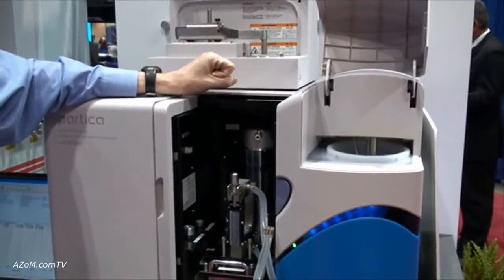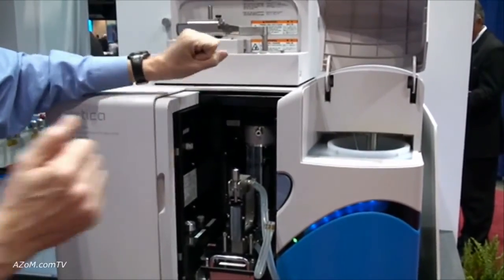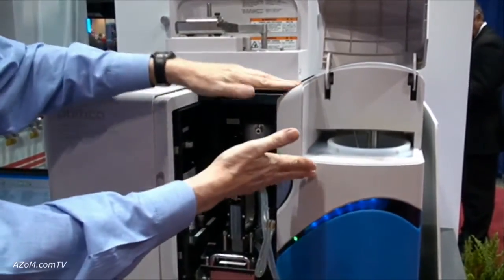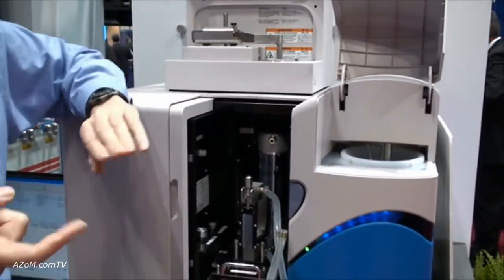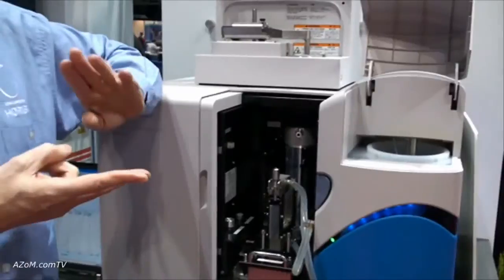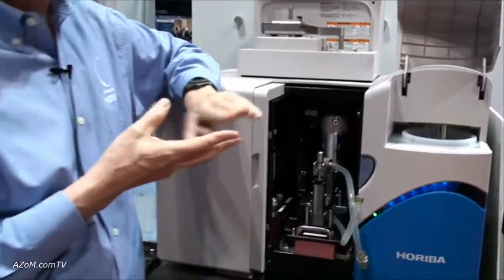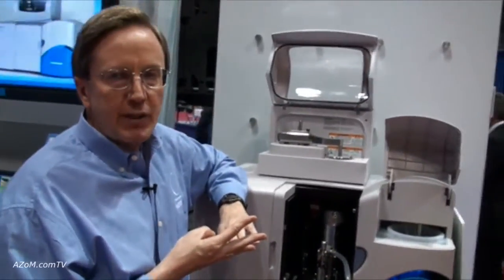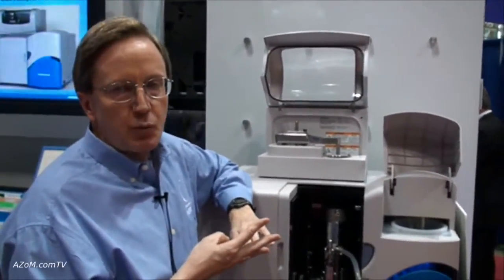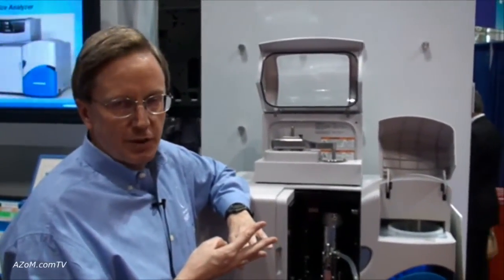What you see here is a system flexible for suspensions and for powders. It's quick, it's reproducible, and it can measure a very broad dynamic range of the samples we might want to measure.